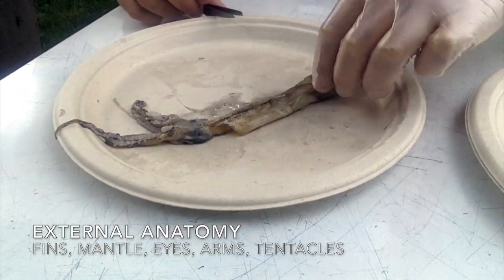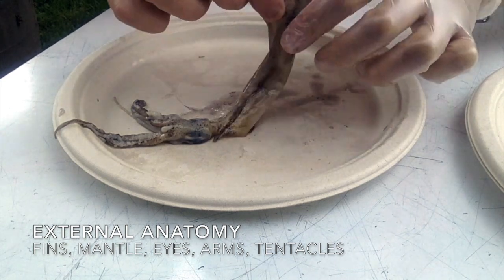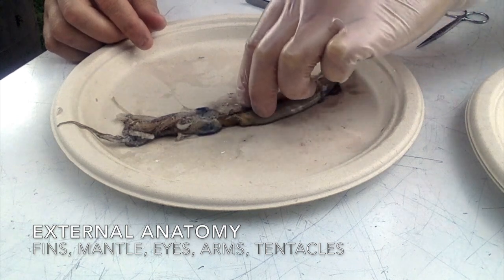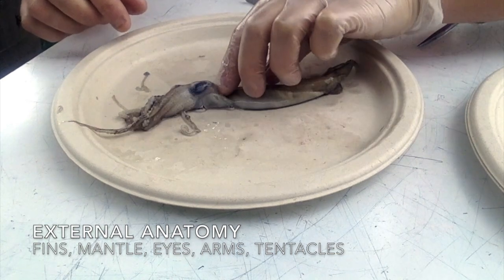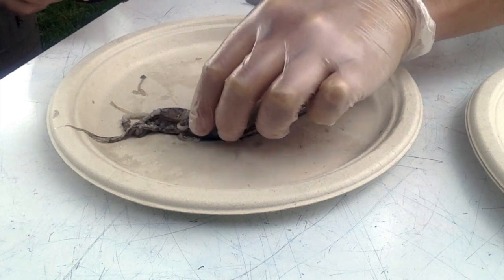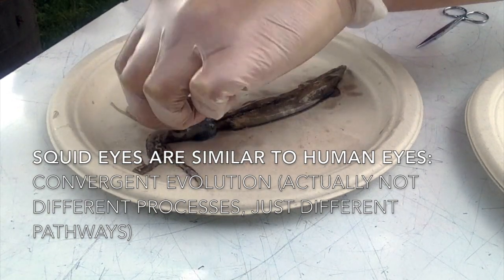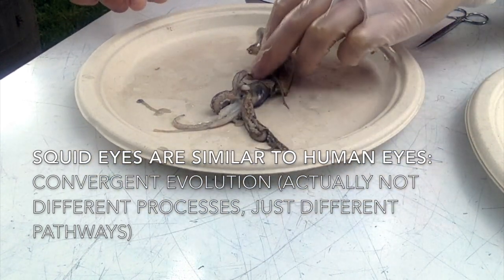On the exterior of the squid, you can see up here I've got the fins, and the fins help steer and change direction when the squid is swimming. This is the mantle, the large part of the body. You can see the eyes on either side of the head. Massive eyes for the size of the body. And their eyes are a lot like ours, but we have very separate lines of evolution, squids and humans. And so that's a really great example of convergent evolution.